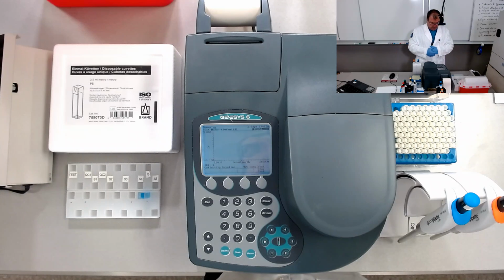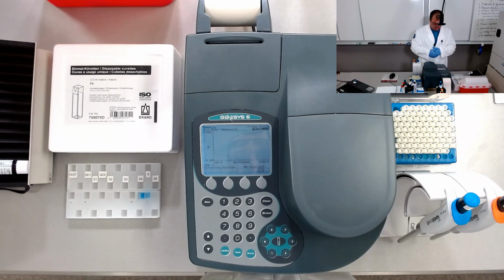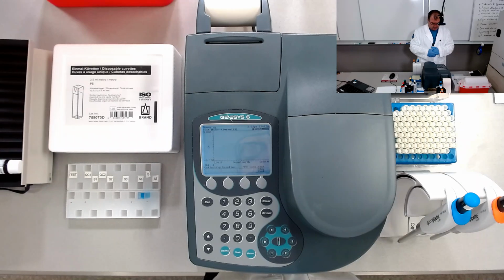We are almost done with the collection of the baseline, 99%.